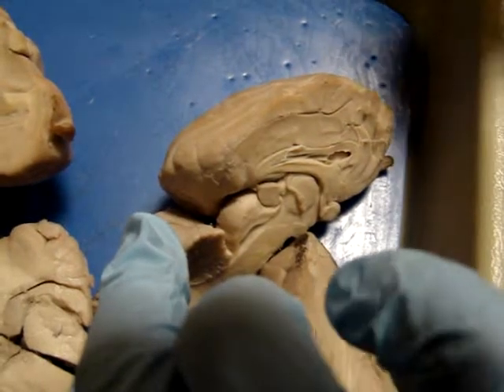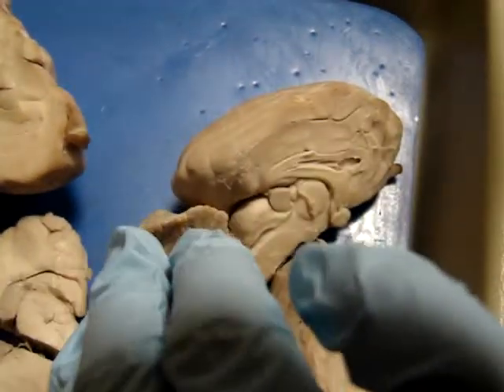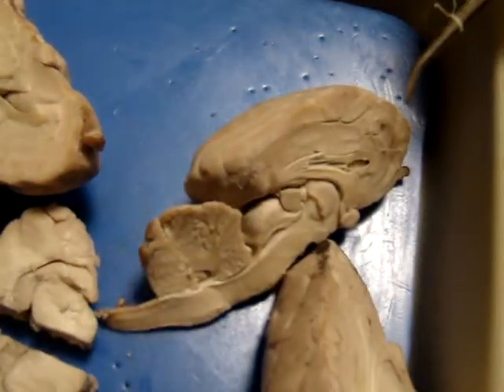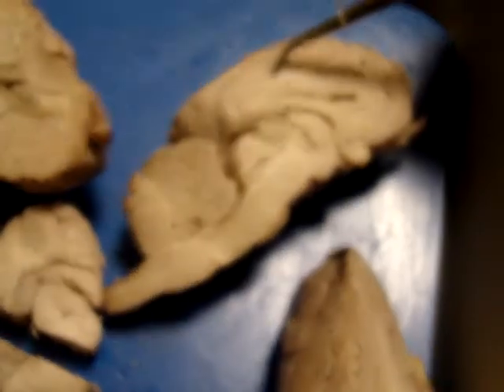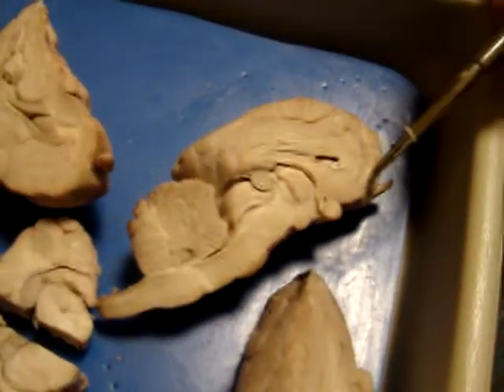Right? The instant auditory or visual responses. Or like a flash, and you blink. Now in humans, ours aren't as big as in the sheep. Ours are smaller, actually. Those are ginormous. They're reflexive responses. Also, another thing that's ginormous on the sheep compared to us is, take a guess.